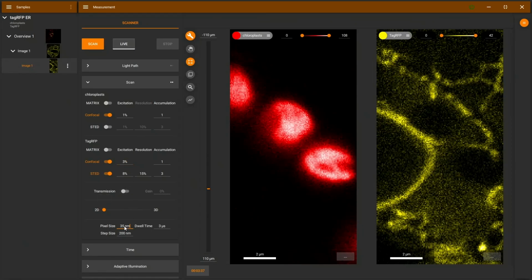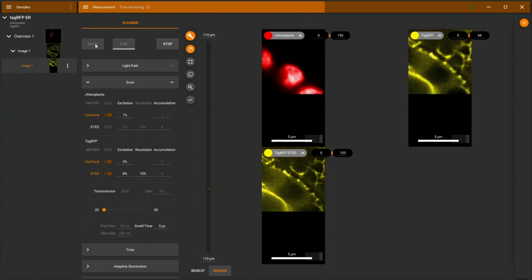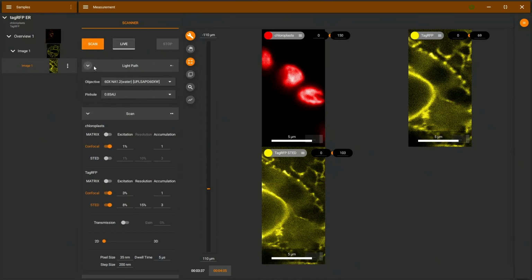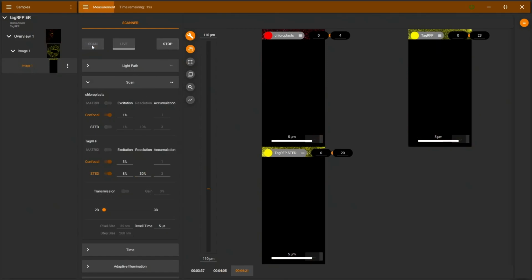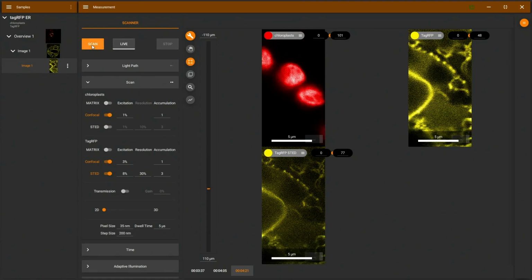Pixels need to be smaller because now we're looking at structures with a better resolution. And then we can start with that scan here. At 15% STED laser power, we see only a marginal increase in resolution here, but we can see a little bit more finer structures on the bottom here. I'll crank the STED laser up to 30%, and we can now see more detail on the top right corner here.